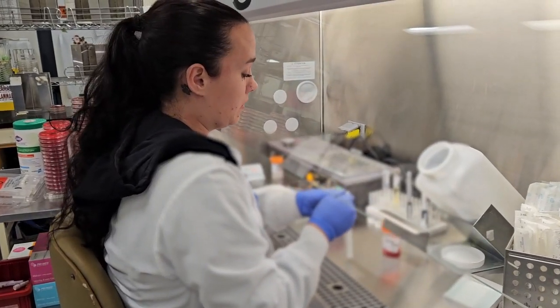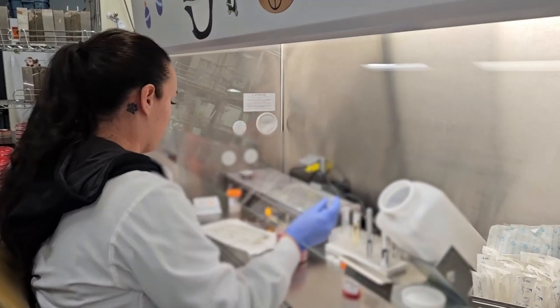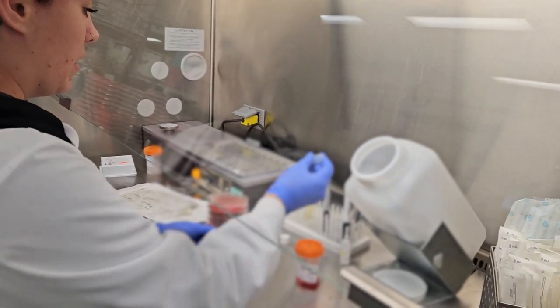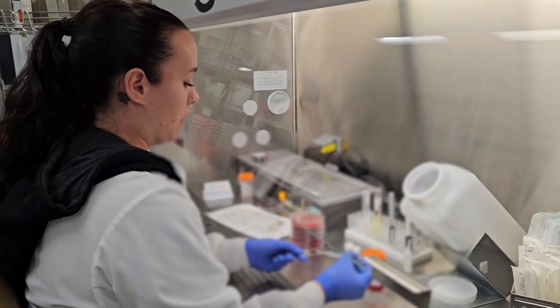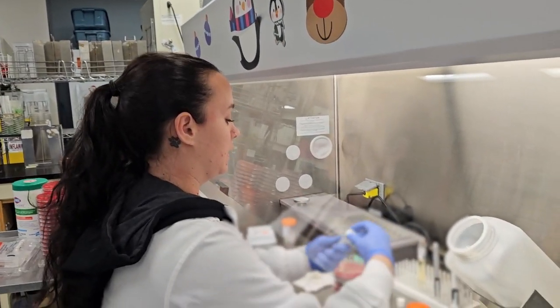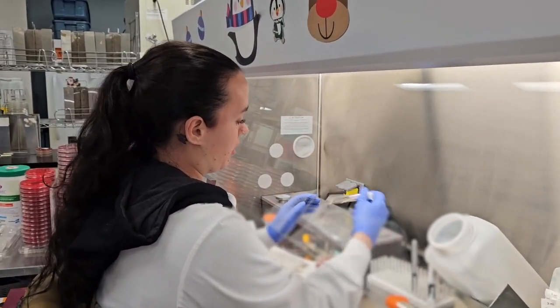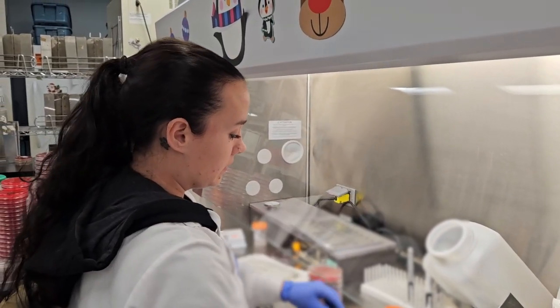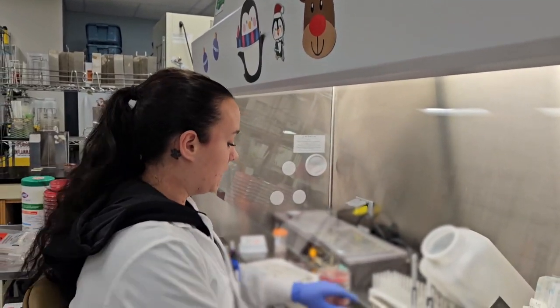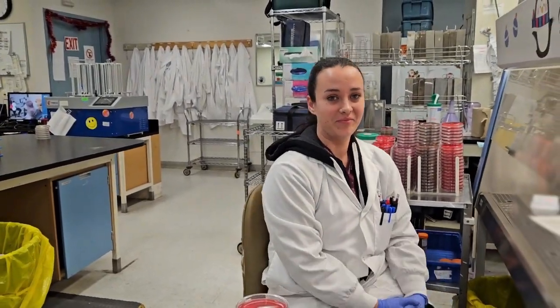I'm going to grab another pipette here, go back into our sample, grab my slide, place one drop on the slide, and spread it out. And then that goes on our slide warmer to dry. Close this all up. Invert our broth here to make sure our tissue sample's in there. And then our plates will then go on the isoplater to be streaked and then incubated. And that's it. Thank you.